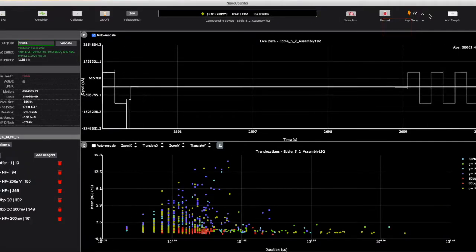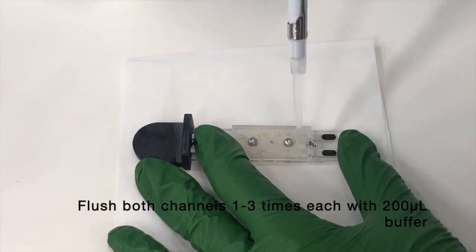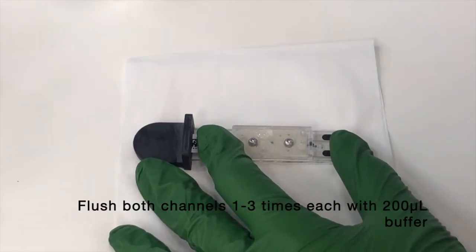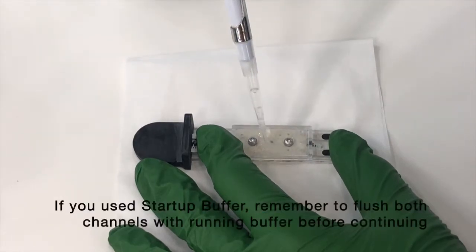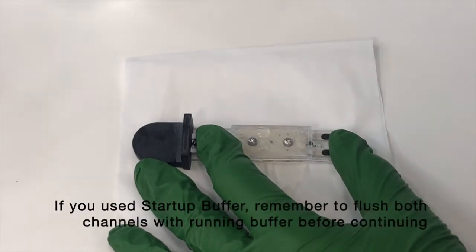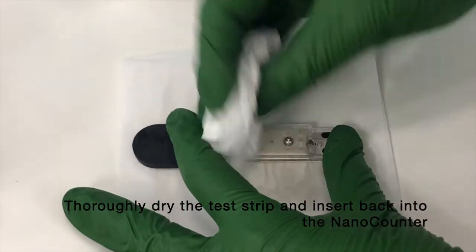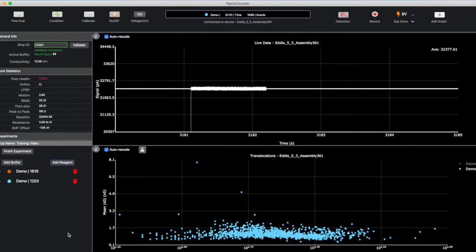If zapping is not sufficient, the next step is to stop recording data, remove the test strip, and flush both channels with buffer. You may use either your chosen running buffer or the provided nanopore startup buffer. Alternating between these two buffers may also be effective. Flush each channel 1 to 3 times with the buffer of your choice. Remember to switch back to the running buffer before continuing your experiment if you use the startup buffer to flush out a clog. When you're done flushing, dry and insert the strip back into the nano counter and turn on voltage to see if the clog is cleared.